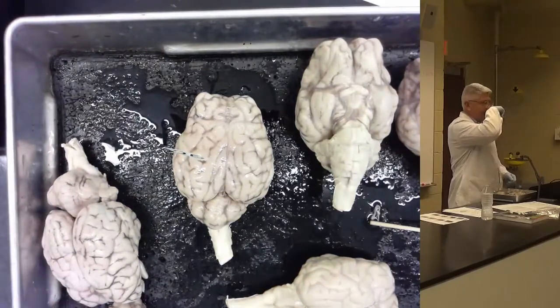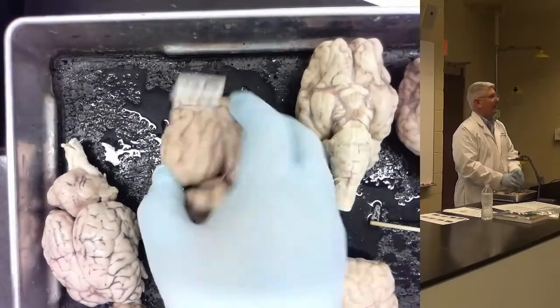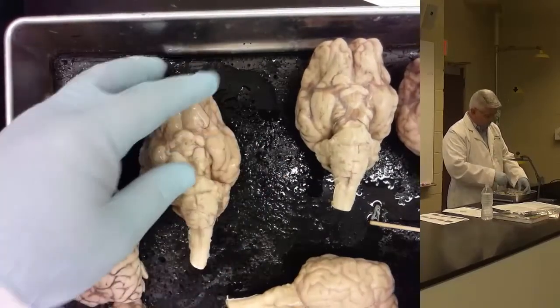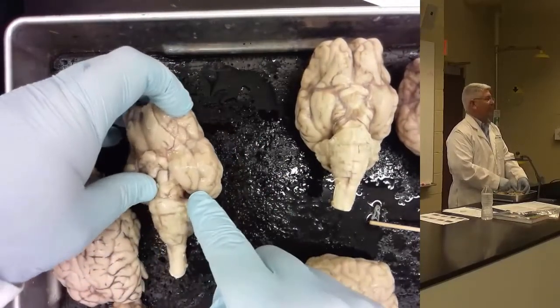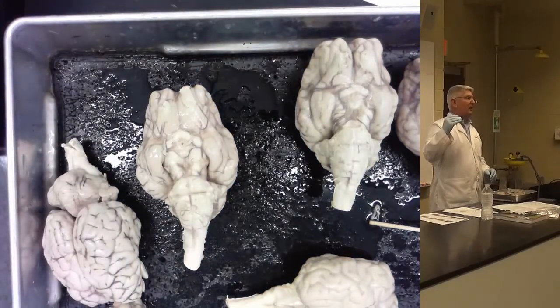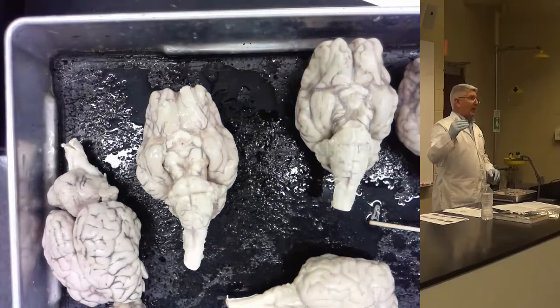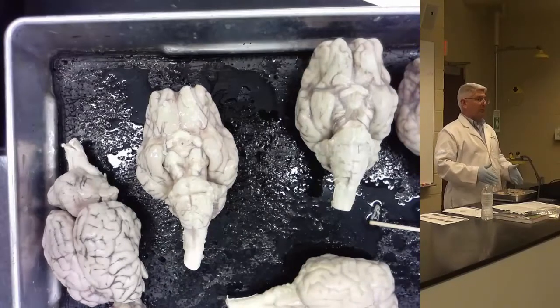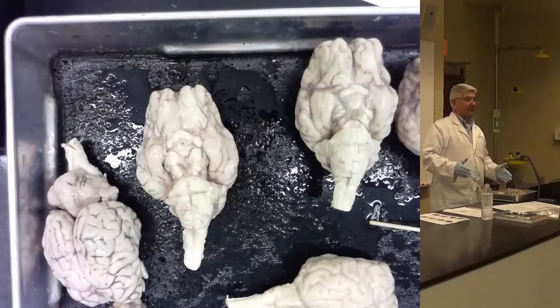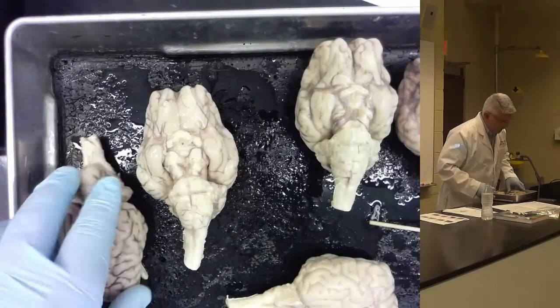So rhinal separates the hippocampus and the inferior temporal? Yes, but you're not going to see an inferior. This has 1 gyrus for the temporal lobe, not 3. Okay. So you're only going to see the superior, middle, and inferior temporal lobe in the human brain. Okay. And I won't mark the temporal lobe or the temporal gyri at all on the sheep brain. They're just not there. It's too difficult to do. Okay? All right.